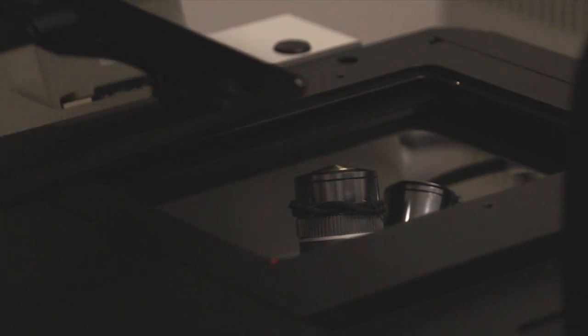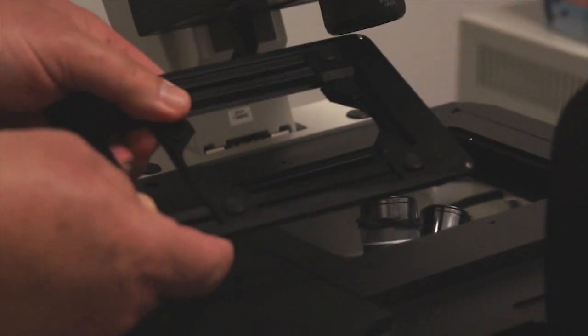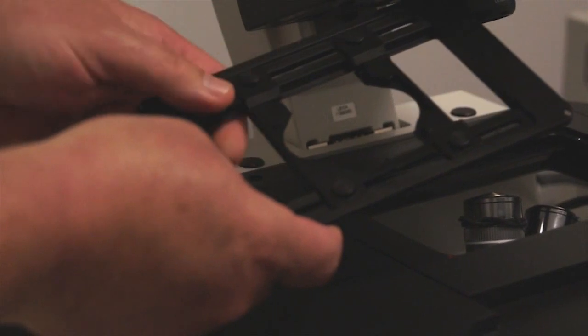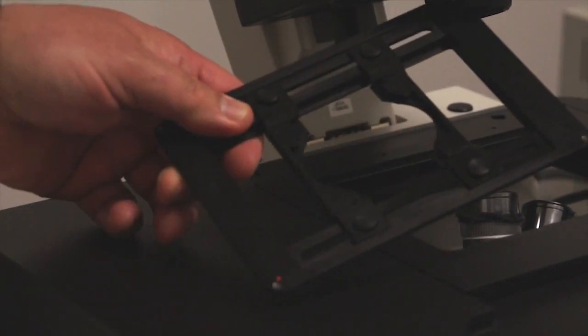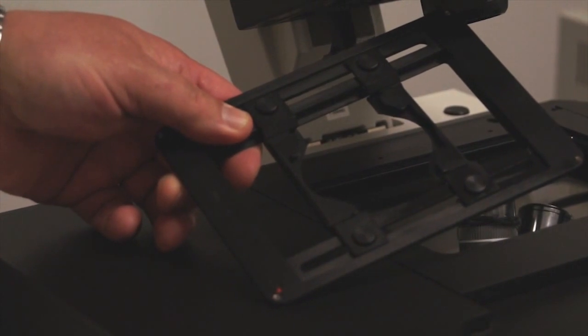The other feature of this insert is that it allows you to close these sliding holders down so that you can put your slide in there for observation of specimens on glass slides.